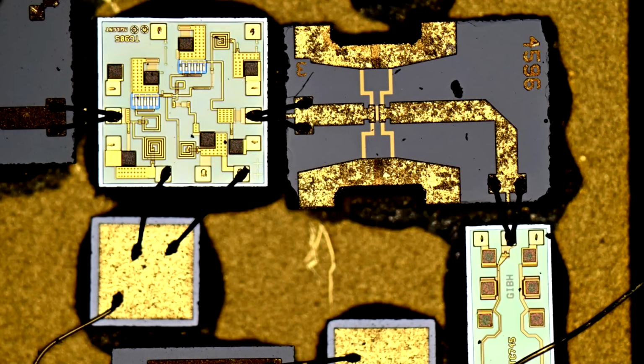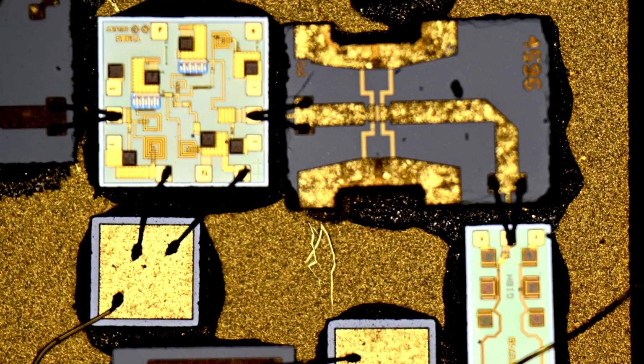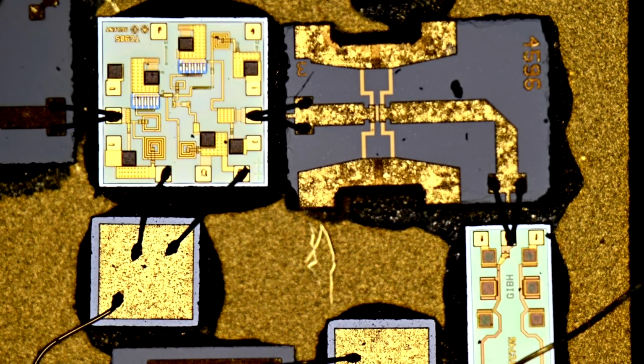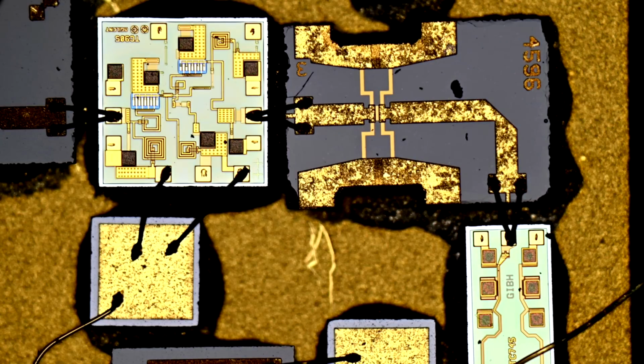Very cool. So even at low magnification, this is using the 5x lens, so total magnification of 50, when the structures are not planar, you can get even large things to not be in focus at the same time. For example, if I want to look at the bottom of the substrate, the bottom of the substrate is here, and everything else is completely out of focus in that case. And I can go all the way to the top, and you can see the die to be in focus now. This is from a Keysight synthesizer.